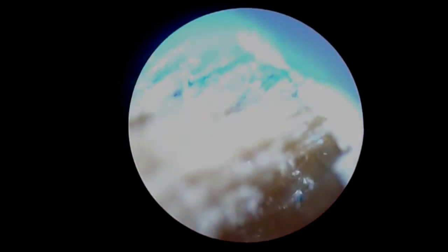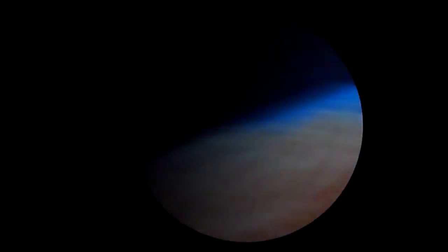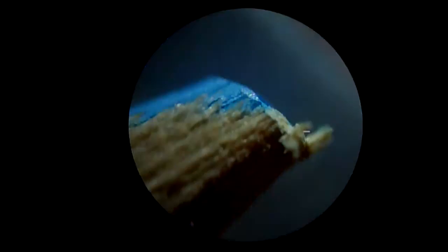Here's a quick demo of a new Olympus microscope. I'm already at 10 times, so I'll bring it back up to four times objective through the eyepiece, which means the eyepiece is 10 times.